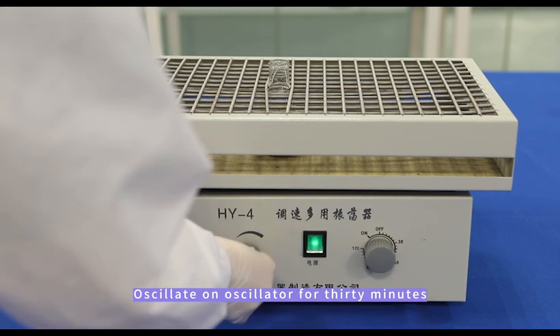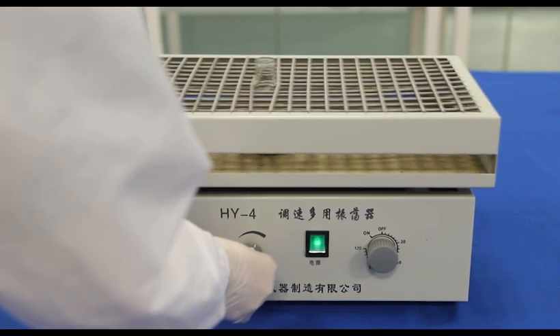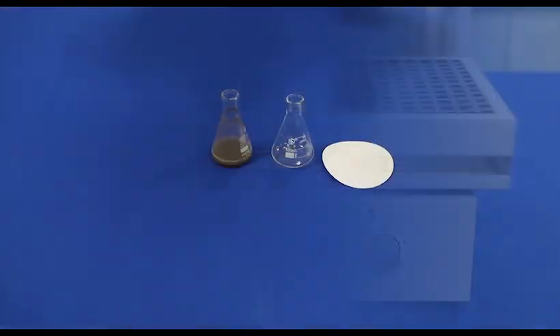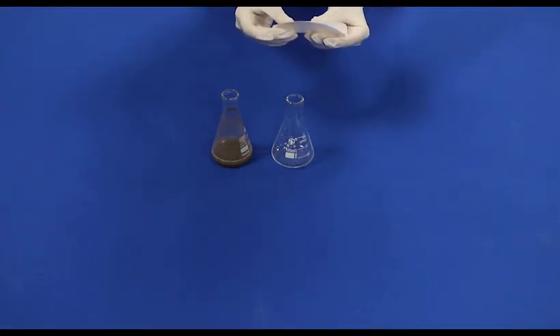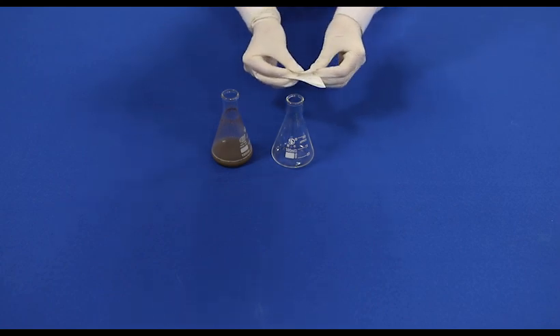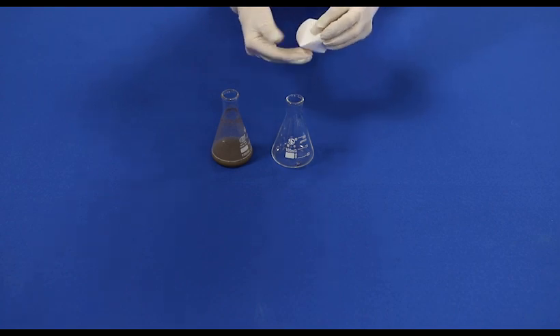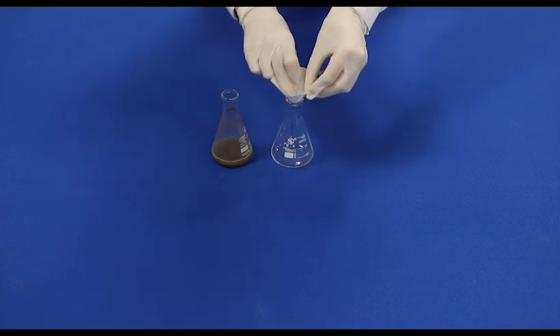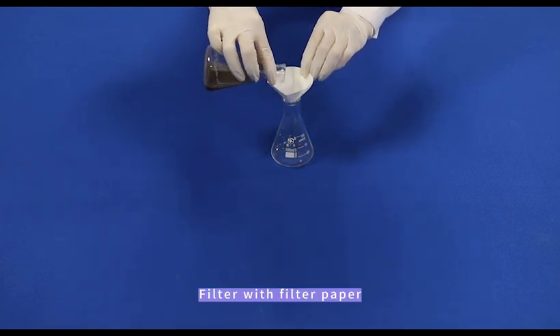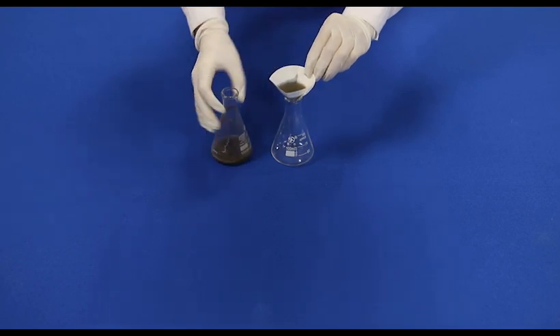Oscillate on the oscillator for 30 minutes. Then filter with filter paper. The filtrate is the liquid to be tested.